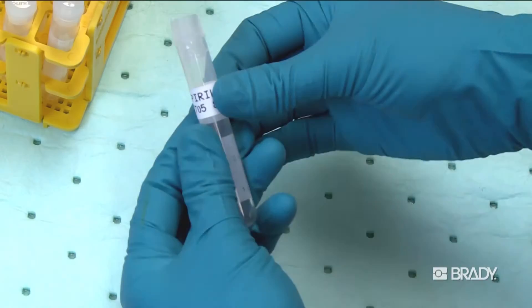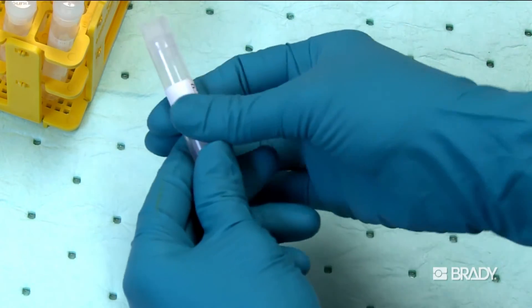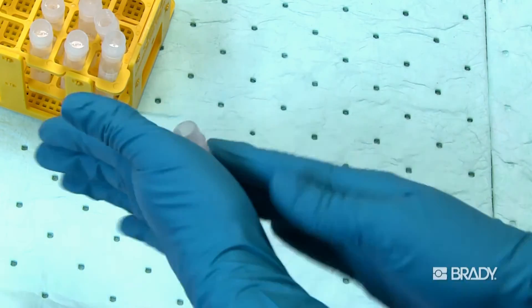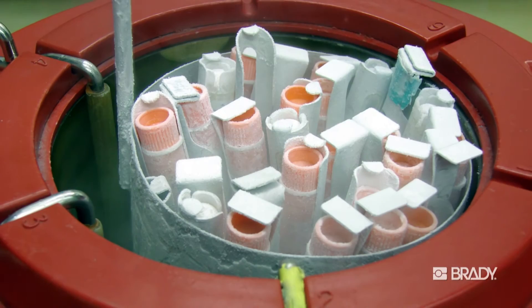Roll the label around the remainder of the tube, making sure that the label overlaps for a secure bond. Then, for one or two seconds, roll the vial between the palms of your hands. This will ensure a consistent bond of the label adhesive to the container. Then simply place the tube in the freezer or the tank.